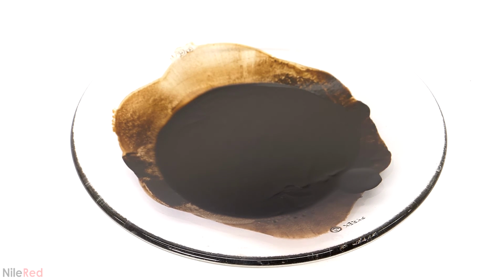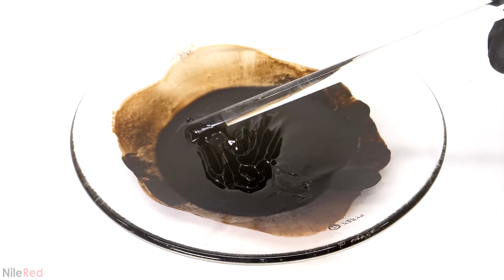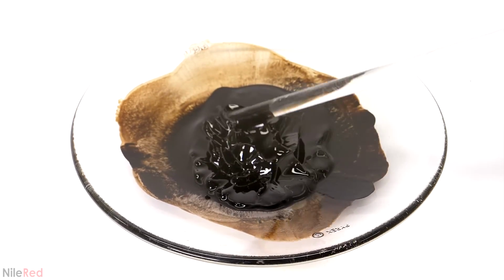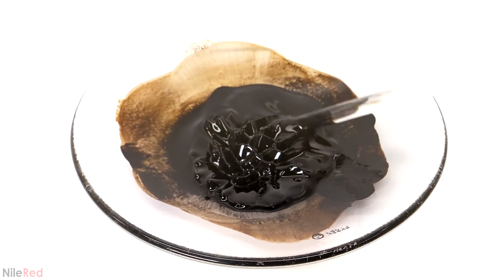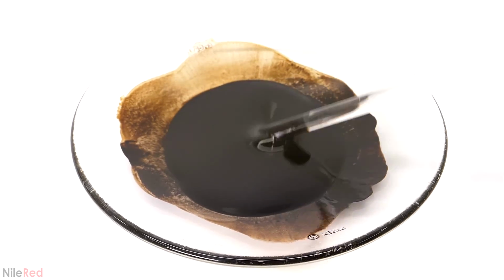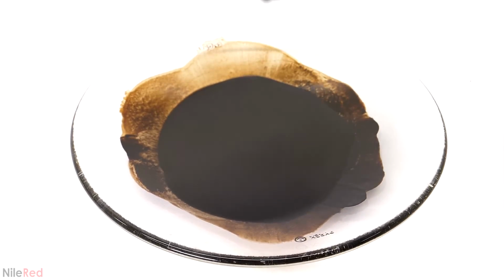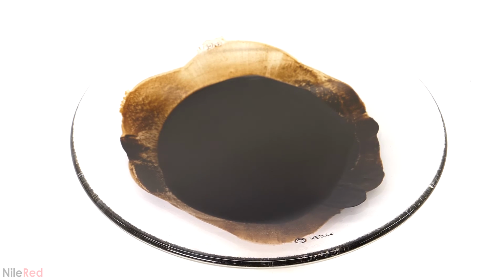For example, this one was a liquid, but when a magnet was brought close to it, it got a lot thicker. When the magnet was taken away, though, it almost instantly went back to being a liquid. I think this happened because some of them were small enough to stay suspended, but other ones were getting pulled out by the magnet. So what I had here was not fully an MR fluid, and it was kind of a mix with a ferrofluid.